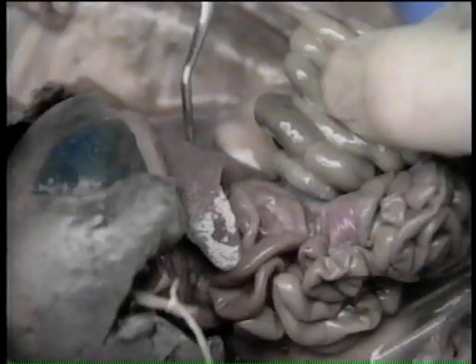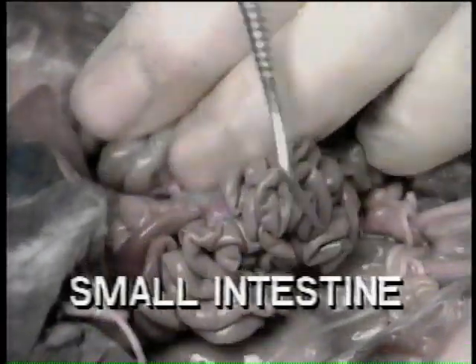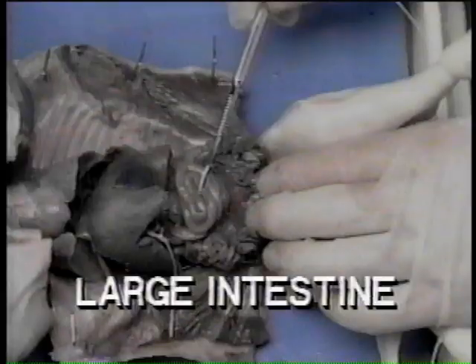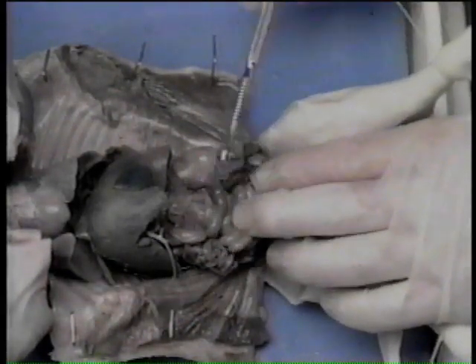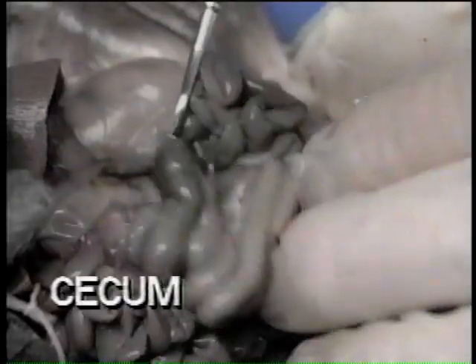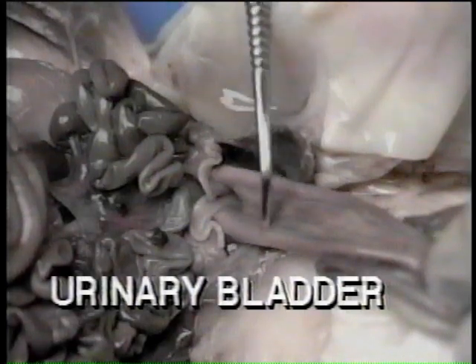The small intestine fills most of the abdominal space. The large intestine is a compact, darker mass of coils. The cecum is a small pouch-like sac at the beginning of the large intestine. And the urinary bladder is the large sac found between the two umbilical arteries.